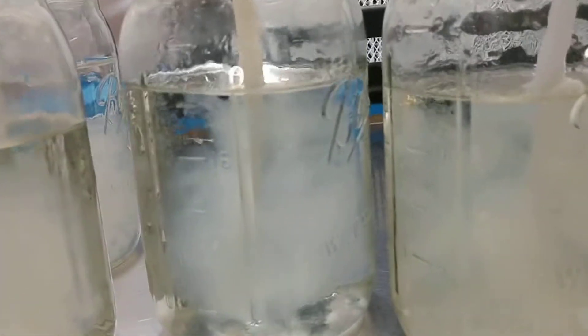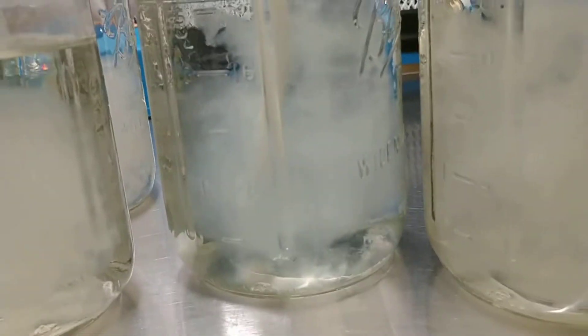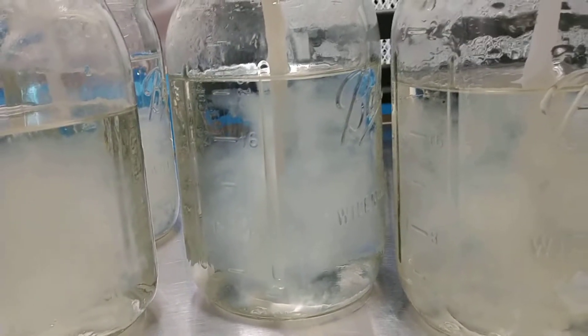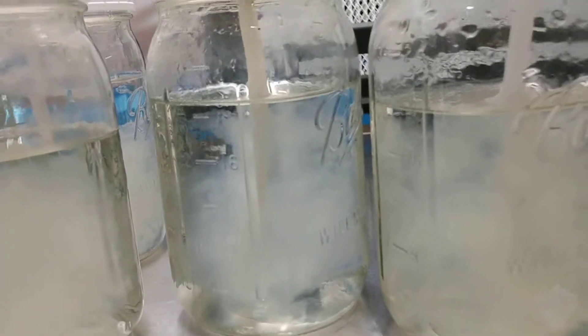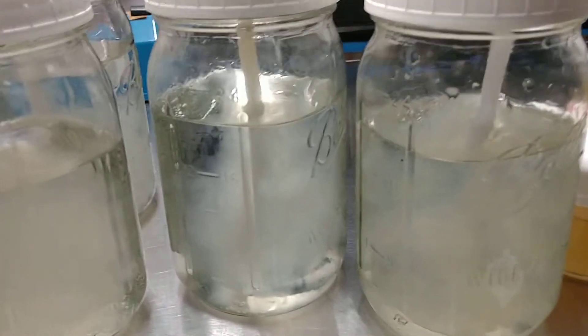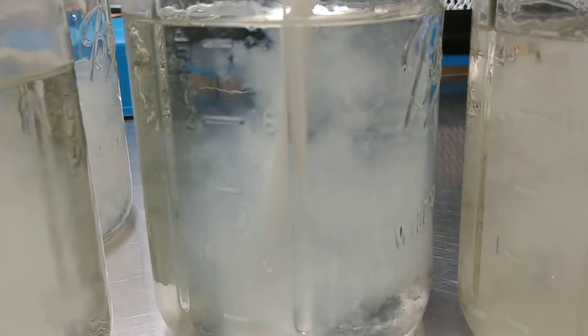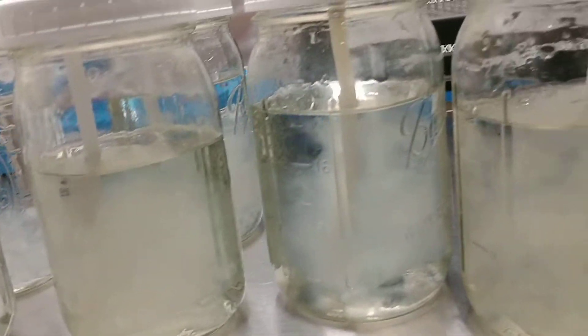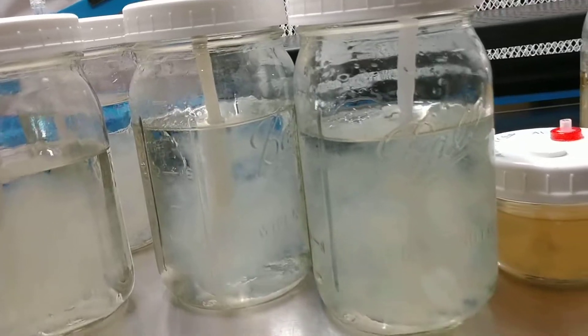So let me tell you, when you take it out of here and put it on grain, it's hungry. You know it's clean, you know it's good. This will last for a long time like this - it could be sitting in here for a year or more.